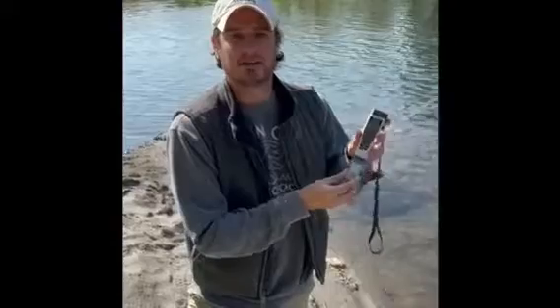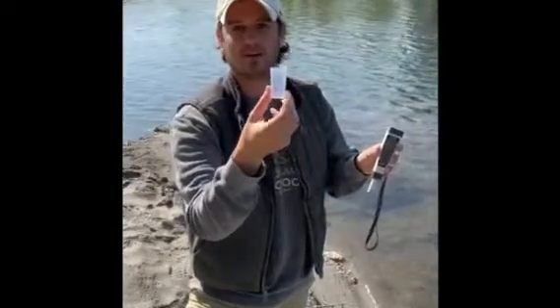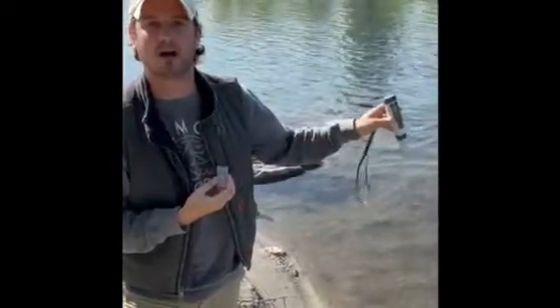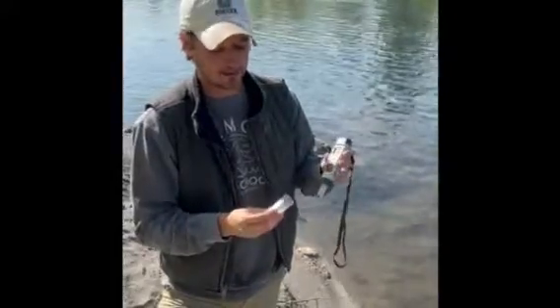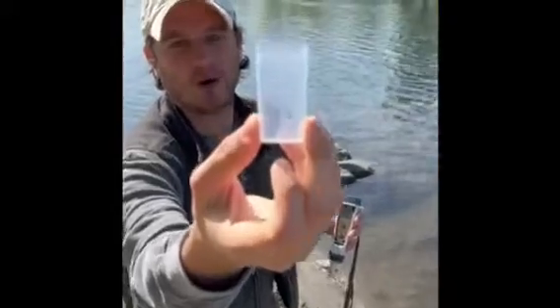Now that the pen is on and ready, you can take your conductivity sample. For these pens you need to use a fill cap to get the reading. You're not going to insert the pen directly into the water, and you're not going to fill a secondary container and put the pen in. For these new ones you need to use the fill cap, and you can see on the cap there's a line that you need to fill the water to.